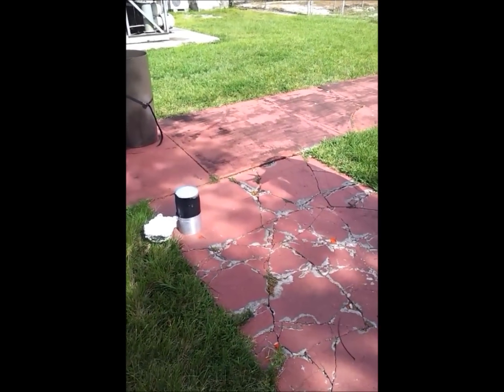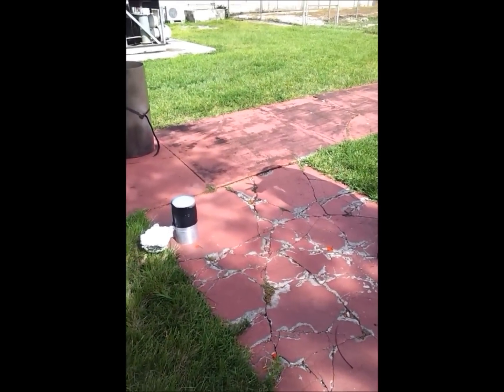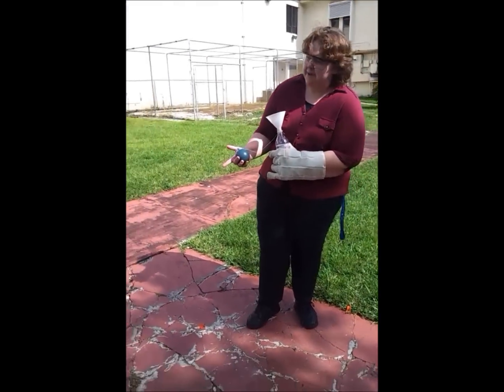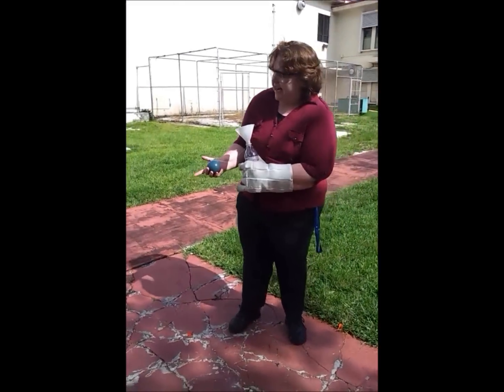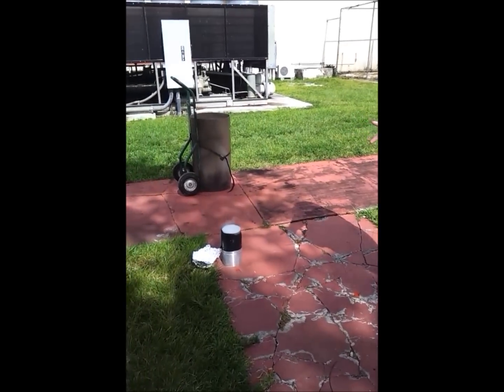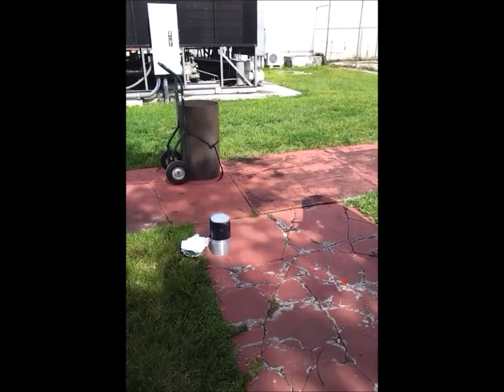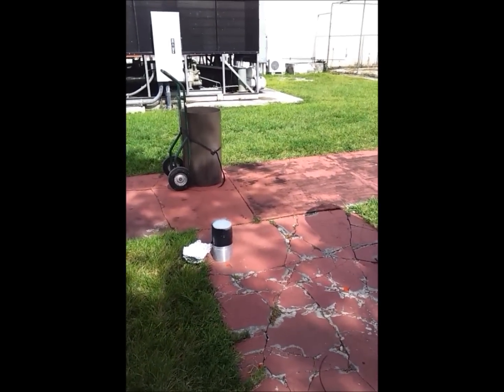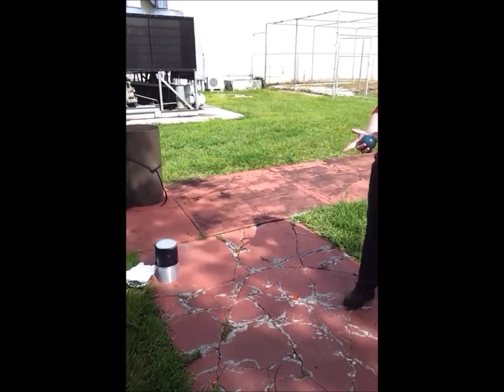It's making the water vapor in the air around the liquid nitrogen really cool, and you can see the steam coming off. Now if it pours a little bit of liquid nitrogen on the ground, what will happen is it will evaporate very quickly.